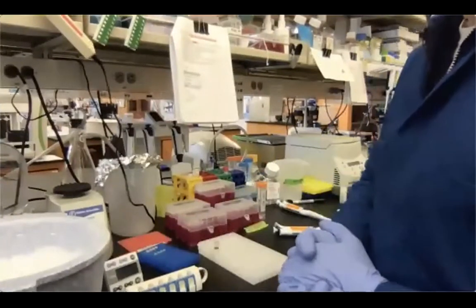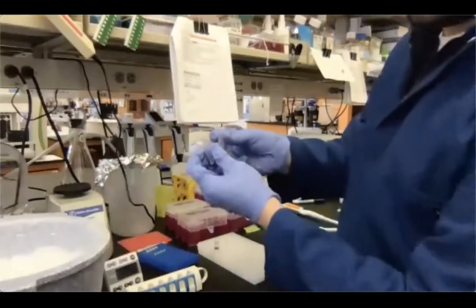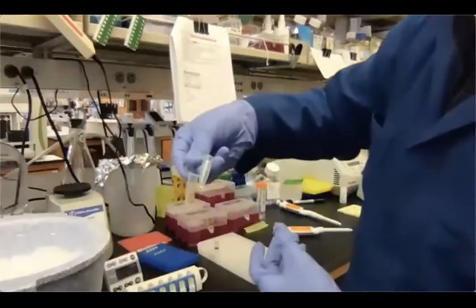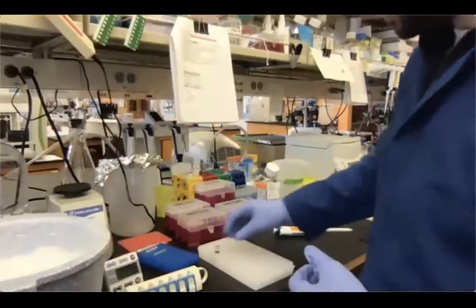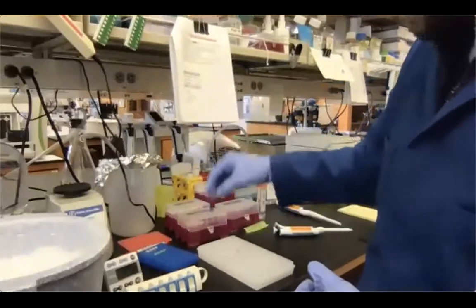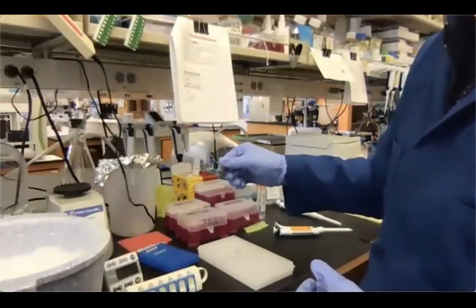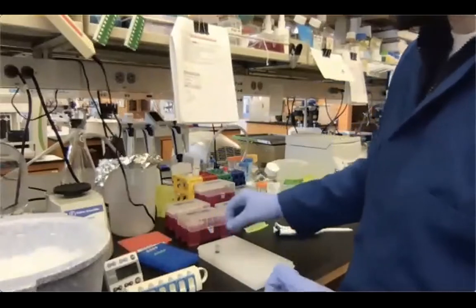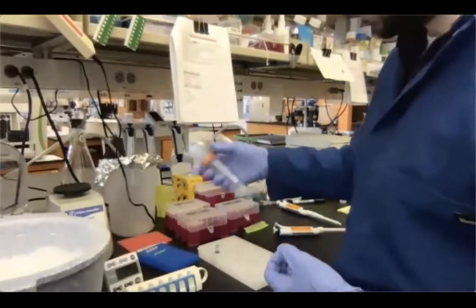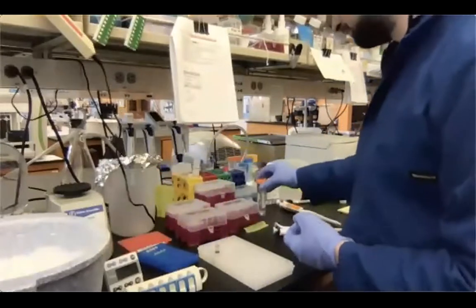Okay, so what do we need for AMPure beads purification? We need our DNA. In this case, I have it in 1.5 ml tubes. Just transferred it from the PCR tubes. We need the beads, AMPure beads. They were rotating at room temperature since the first incubation. So they are very well mixed and at room temperature. And also freshly prepared ethanol 80%.